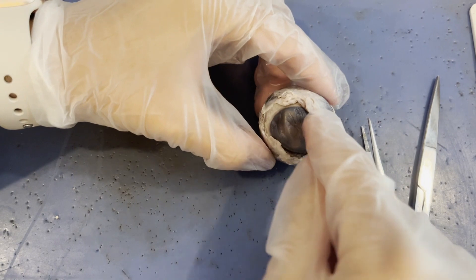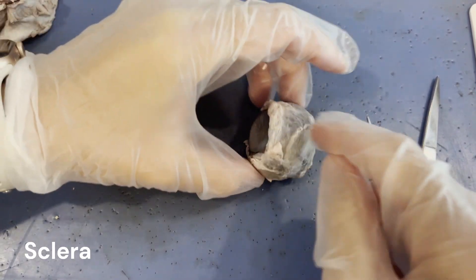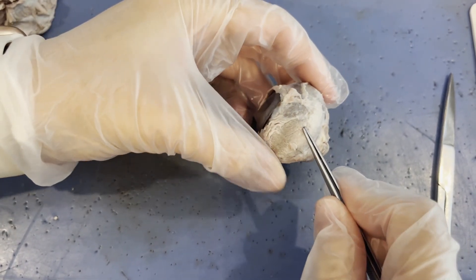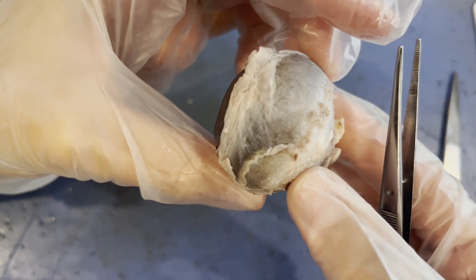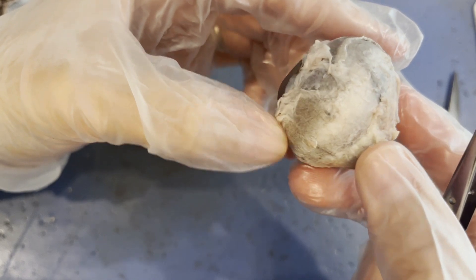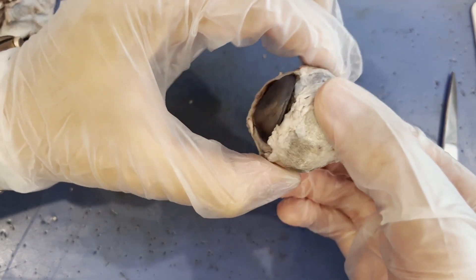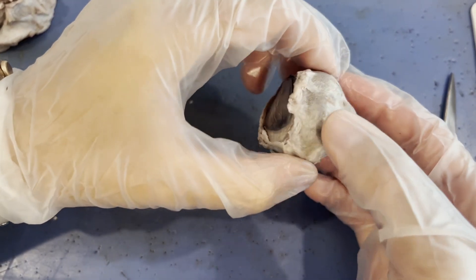The sclera is not here — this is our cornea, remember — but the sclera is basically everything else that we see, and that is the white of your eye. Preservation changes the color of tissue, so this doesn't look very white, but if I zoom in it does look like it has a similar structure to the white of your eye, with maybe some blood vessels crossing over it. The sclera is pretty hard — this fibrous, tough membrane surrounds the eye and helps to maintain the structure of the eye and keep it the shape that it should be.